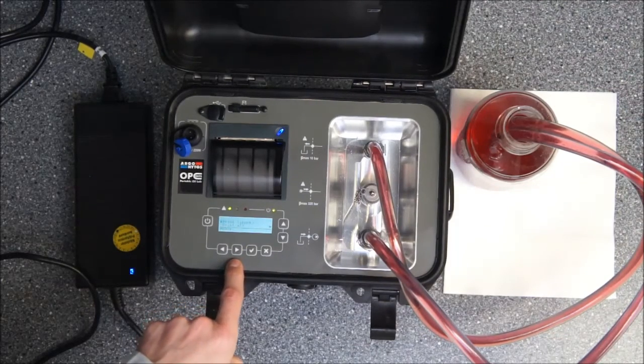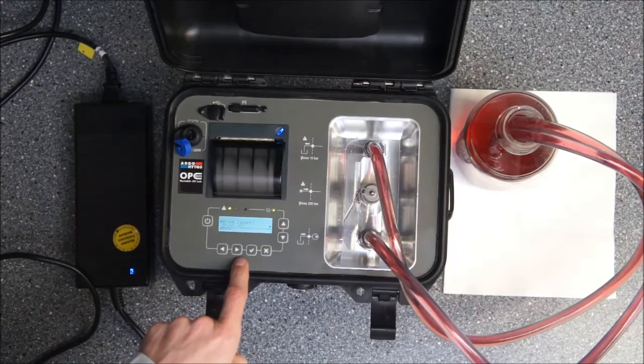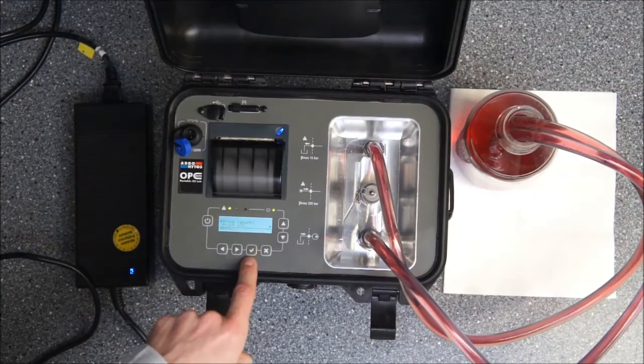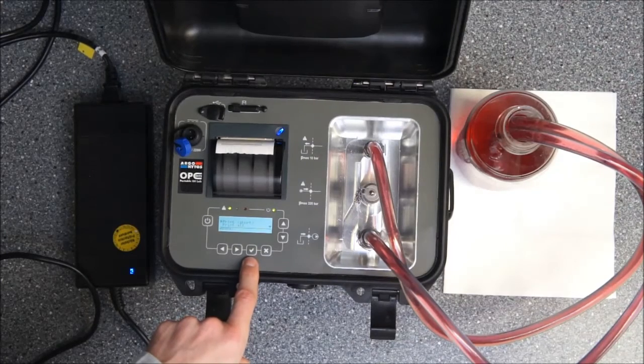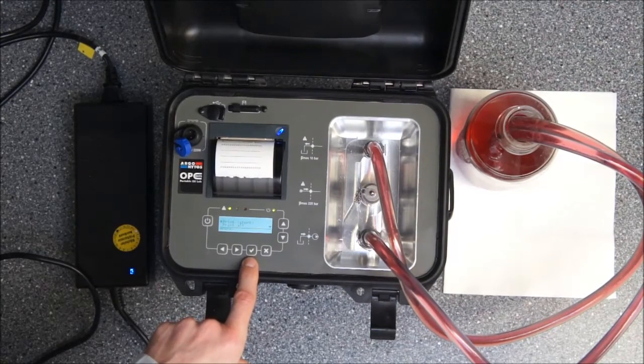I will be at the short menu here and you see print short. That's what we are going to do now and I just push the enter button to activate the printer.